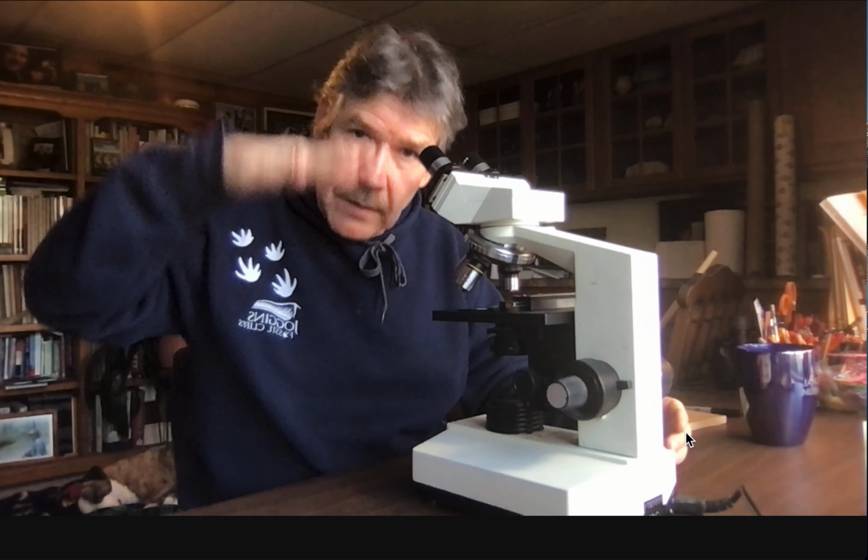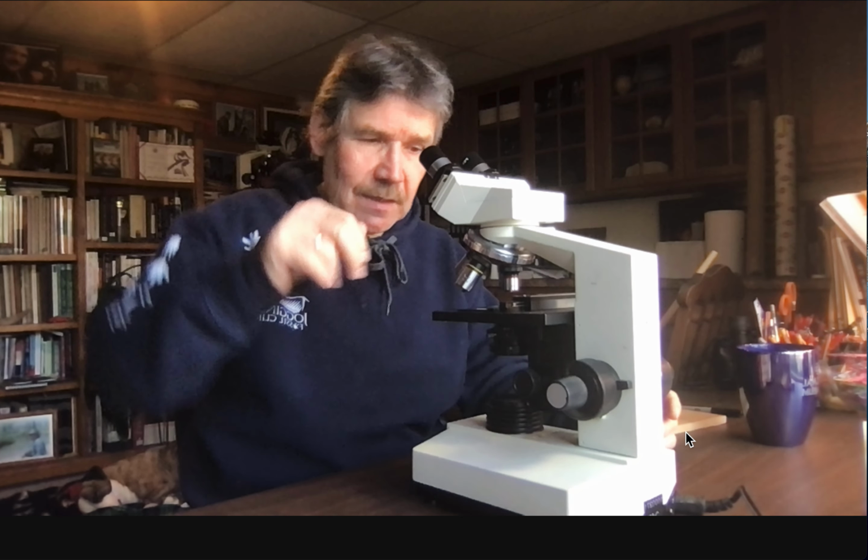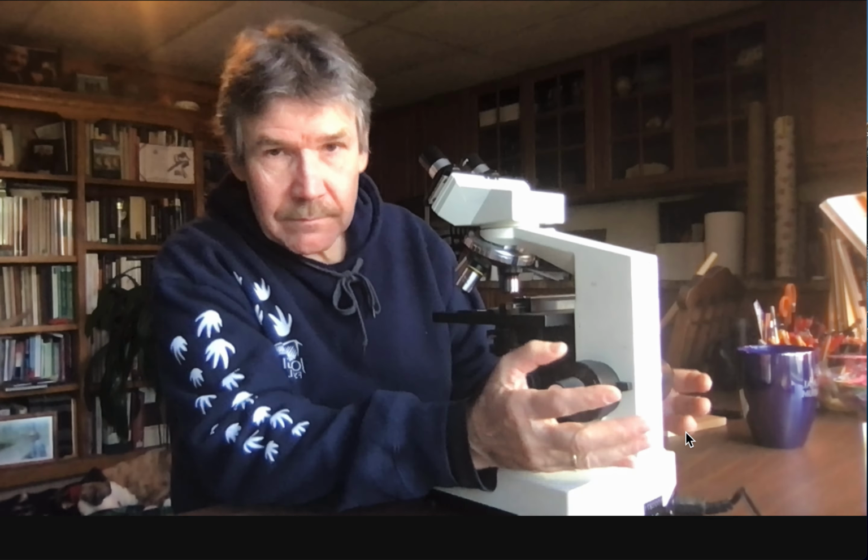I'm watching my working distance, that I'm not going too fast. And then all I do is wait for it to show up and be in roughly focus just by raising it up. I only know there's one direction to go. So I've encountered students who are just focusing up and down, and can't find anything. I'm telling you, start out of focus by being too far down. That's safe. And then focus as it comes up, watching, in case you somehow made some kind of other mistake, that the working distance is still safe. So right now, with just rough focus, there you go, this whole thing's in focus.